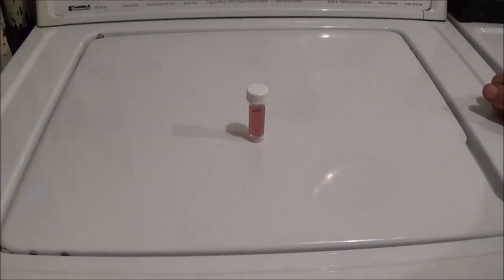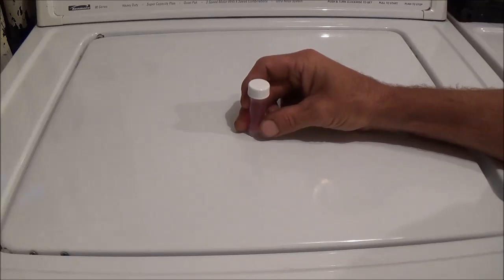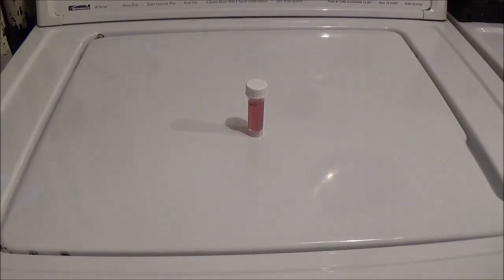Well, here we are, a little bit over 48 hours later. We waited our two days. This was the most exciting test right here. With this one, if it was yellow it had bacteria, and if it was purple there was no bacteria. So I had Sarah come in here because I have a little trouble with colors, and she looked at it and said, that is purple. So that's really good news. You guys watched buying the parts, had to excavate the hole because of all the rocks, put the parts in, got water pumping and had to pump forever to get it clear. At the end of the day we have a workable pump with completely drinkable water. Thanks a lot for watching the last part of the tent well.